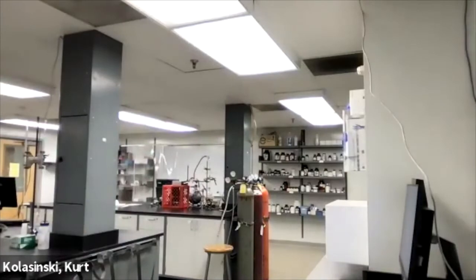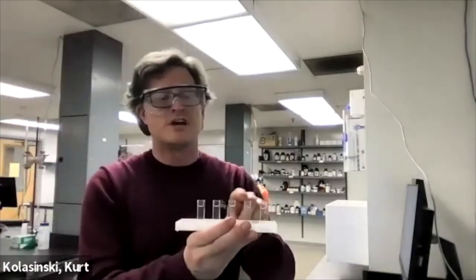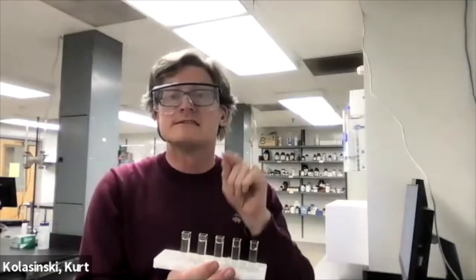And now, all we need to do is pop our solutions in the cuvettes. Got five of them with changing KI, but careful. The fluorescence is temperature dependent. So you have to leave them in there three to five minutes. I was actually good. Left them all in there at least five minutes this time to collect this data.